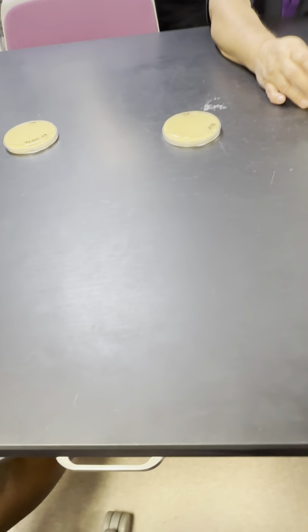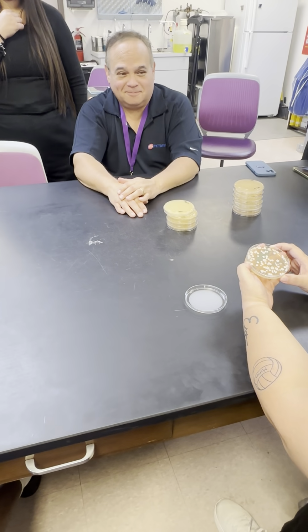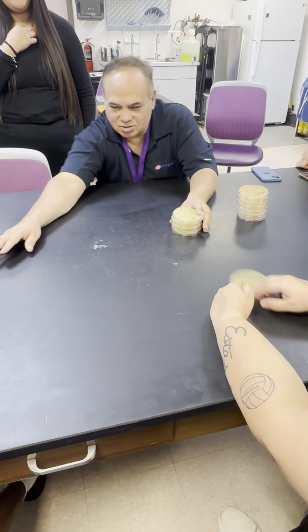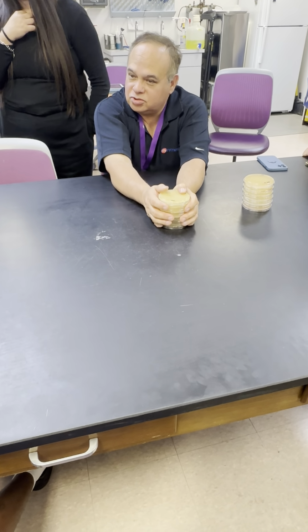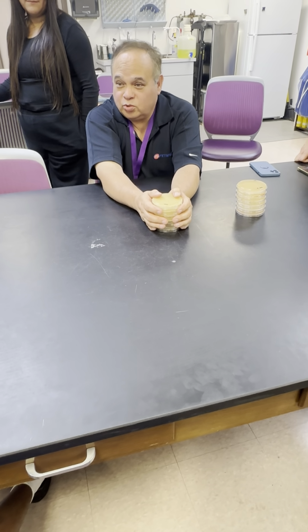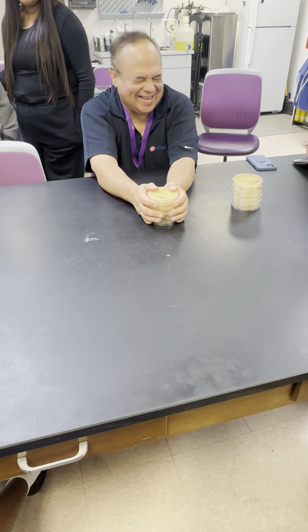Your aseptic technique is not too great, I think. No, mine is perfect. It's the tool that I used, right? I heard mine was perfect too. It was, yours was good. Mine was trash. So I'm gonna keep these things. If you want to take pictures of them, you're welcome to do so. But I mean, I couldn't have asked for a better assay. This is beautiful. And I was doing this while everybody was asking me questions and all kinds of craziness. Oh my God, somebody pat him on the back.